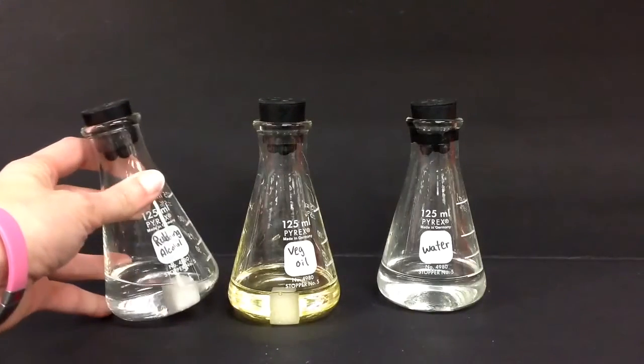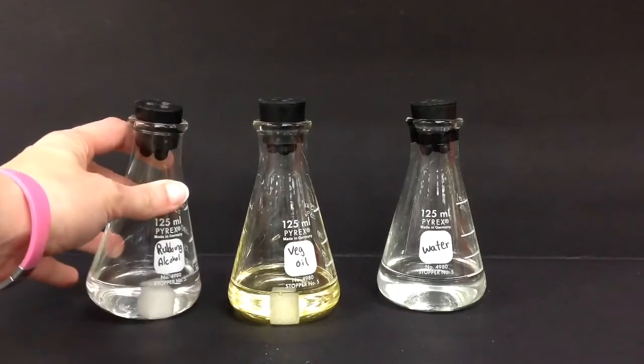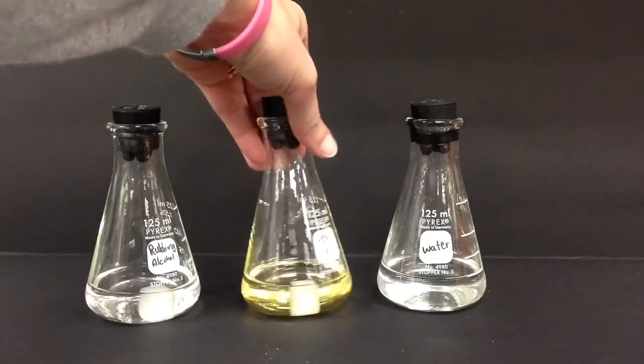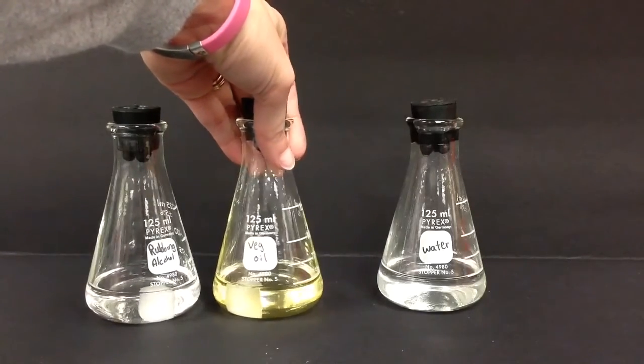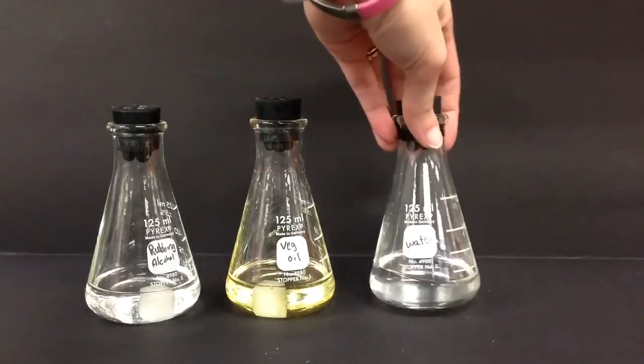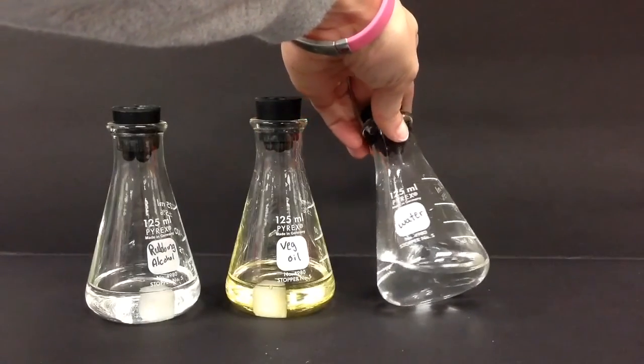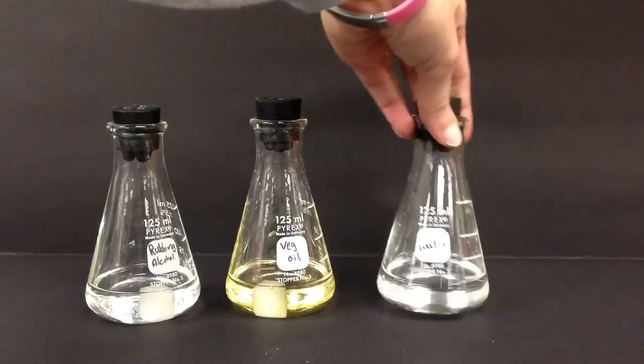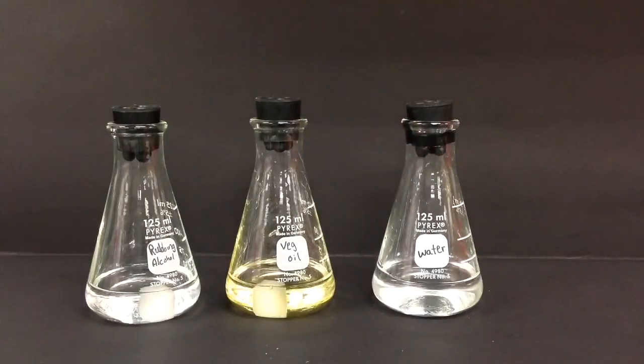Here are the three solvents side by side. Make your final observations and fill out your lab sheet.